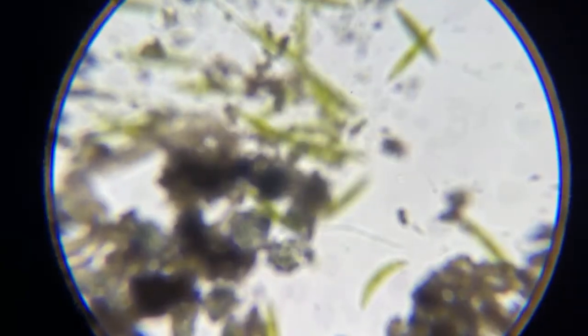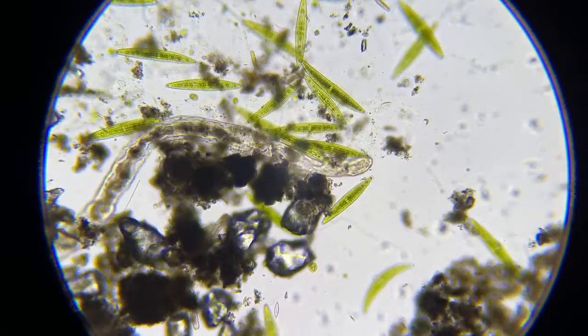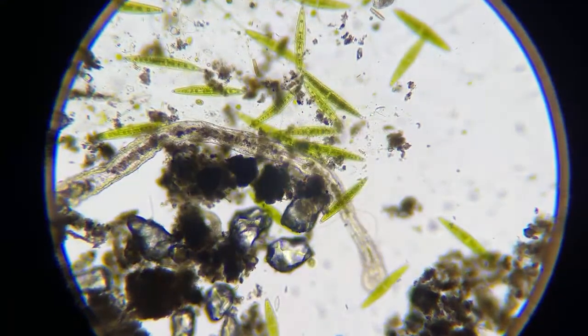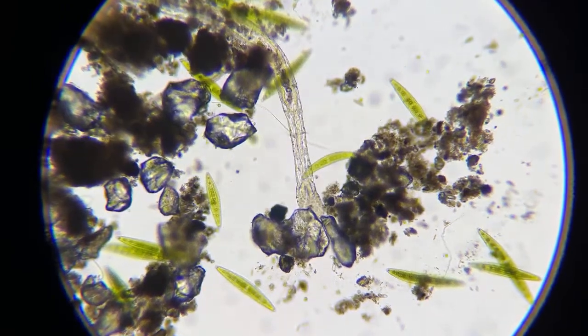Because see, if I go to this power, this is 100. This is how you do experiments, see where your trouble is. And I cover that up, you can still see that faint line right there. Something's on my stage or somewhere that's reflecting. Let me clean my... And it's not on the condenser. So after I'm finished this stream, I'm going to have to find out what that is.